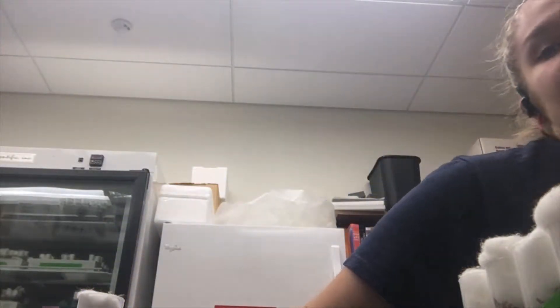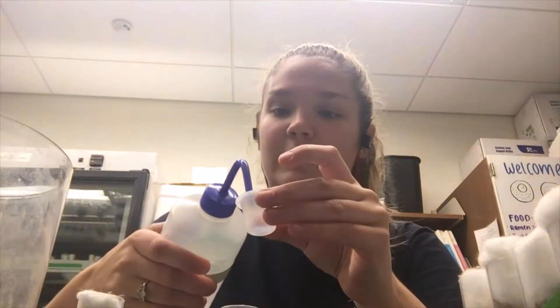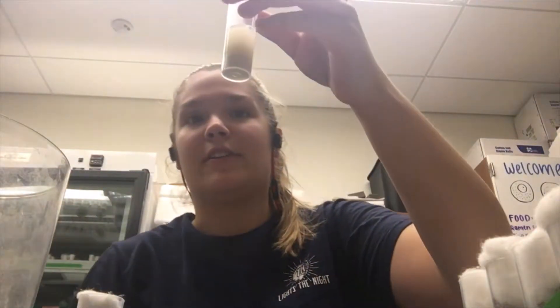First I'll show you how I do it in general. We have fly vials here and food here. Take the funnel, put it in the vial, take food, put it in there, and then you take water and fill up this little cap. Then you wet the food and let it all absorb. Then put cotton on the top, and once you put cotton in there you can put flies in the vial.